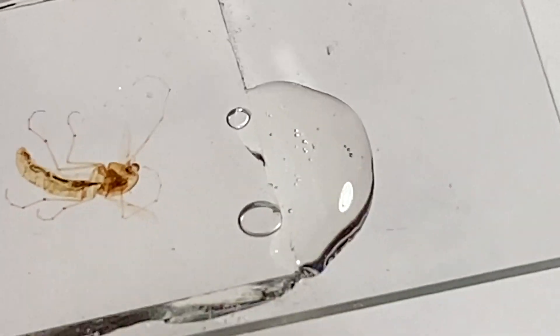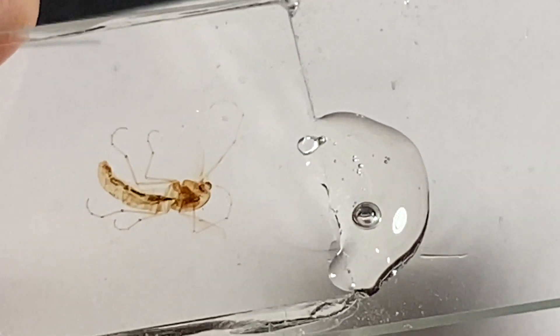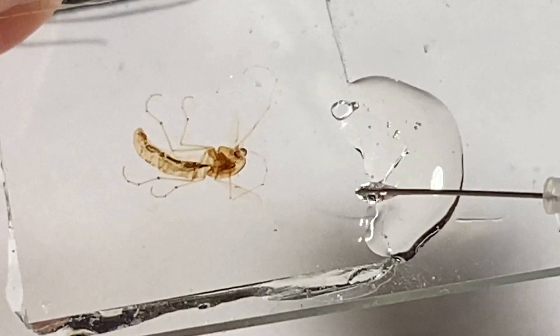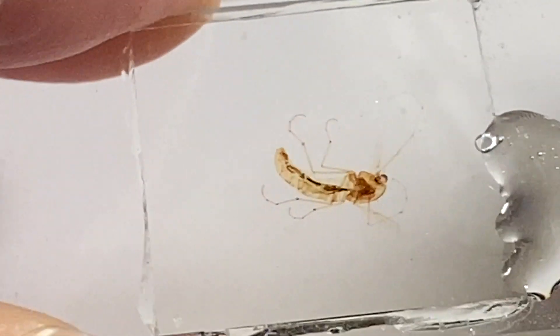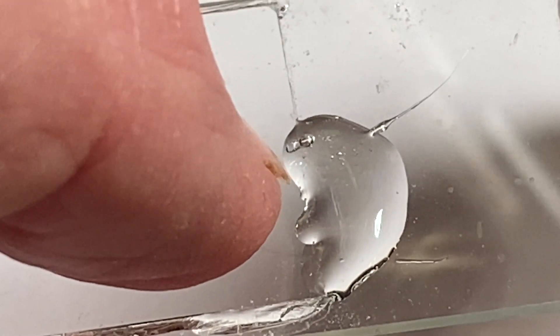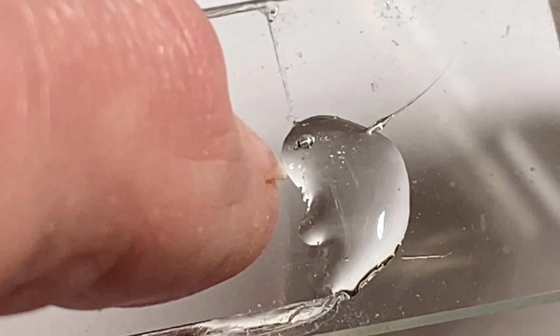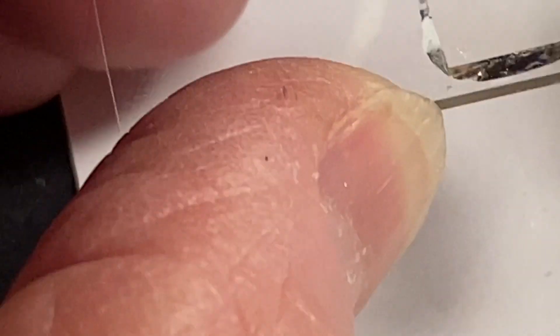So let's try that again. Once I've done that, I'll take that away because this slide is still hot — that's the tricky part. I take my fingertip and push the bubble out like that, then take a syringe needle tip and pop that bubble because it will invariably get sucked back in again underneath the slide. Here's another one over here — I may not have applied enough heat to that part. It looks like it's moving with some pressure, but not too much pressure because there's always a chance you will break the coverslip.